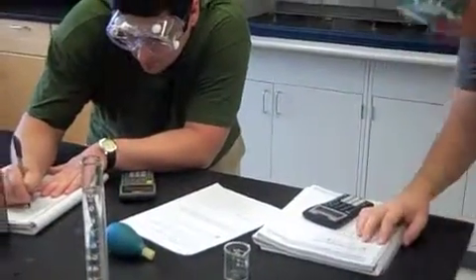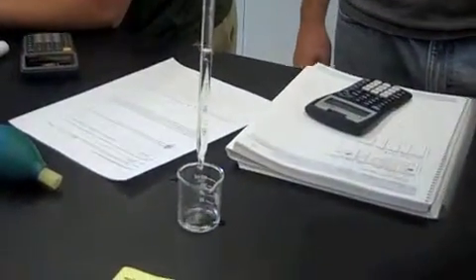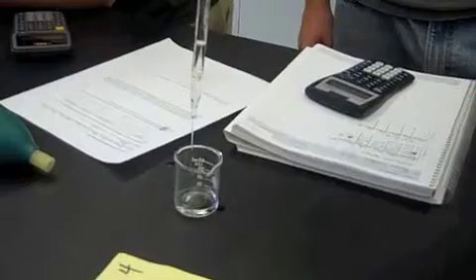There's some that say 1 per person, and those are fine. Now I'm pouring it. And the notebook doesn't say that. One notebook per person. Nice. But you have to do every pipette step. You have to do every pipette step. And then we have to record everyone doing it. So like for the video, does it need to show all 4 of us? Excellent. Well, let's just go over and measure this one.